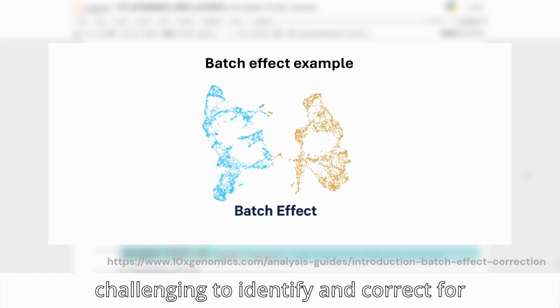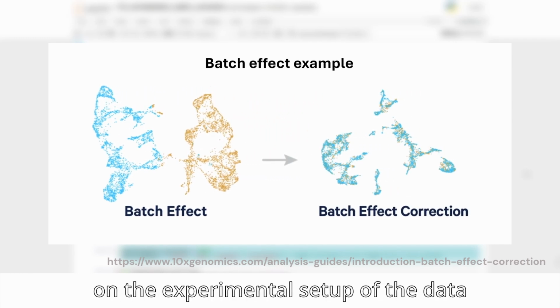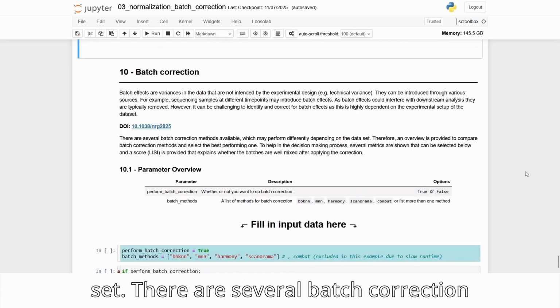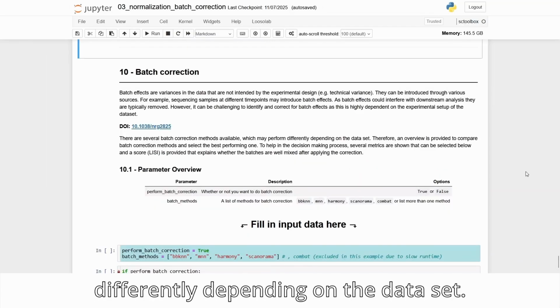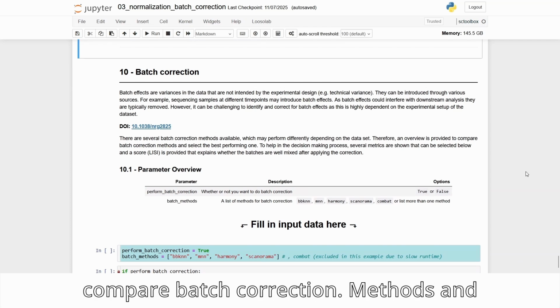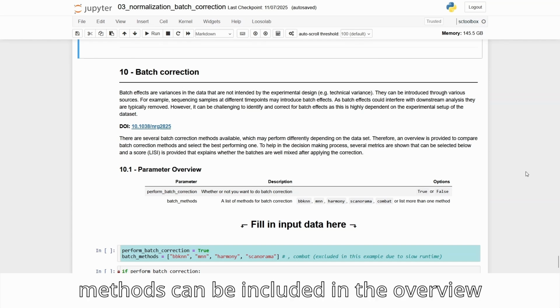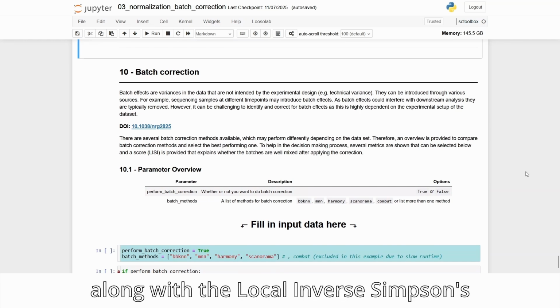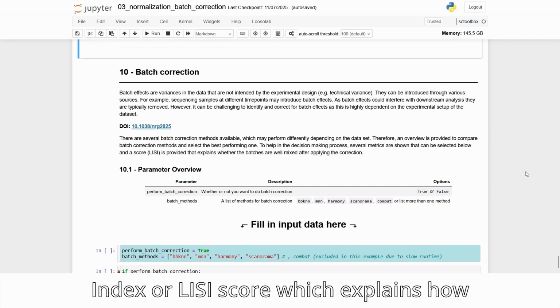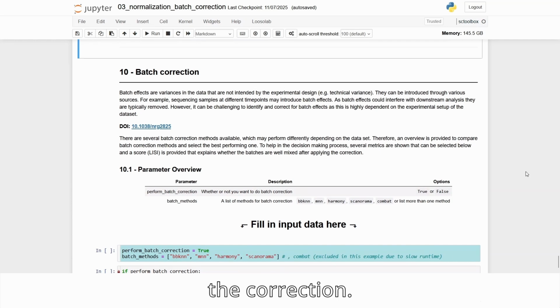However, it can be challenging to identify and correct for batch effects, as this is highly dependent on the experimental setup of the dataset. There are several batch correction methods available, which may perform differently depending on the dataset. Therefore, an overview will be provided to compare batch correction methods and select the best performing one. To help in the decision-making process, multiple methods can be included in the overview along with the local inverse Simpson's index, or LISI score, which explains how well the batches are mixed after applying the correction.